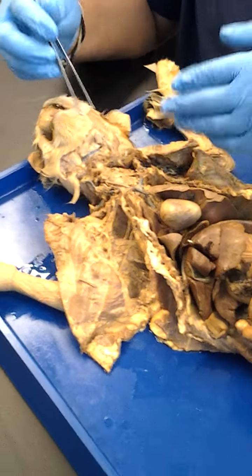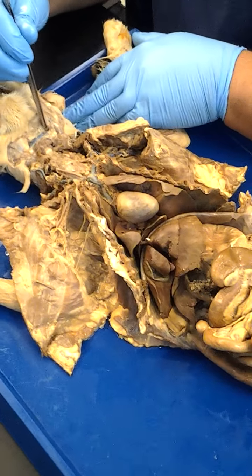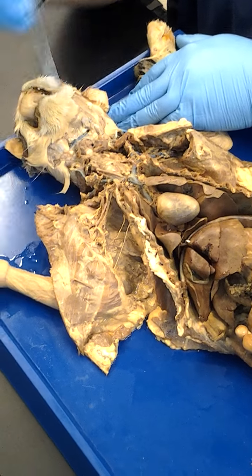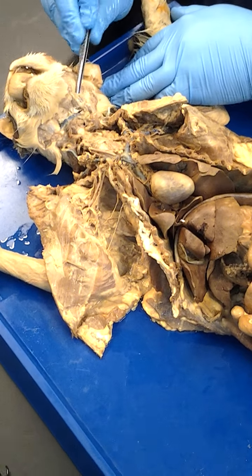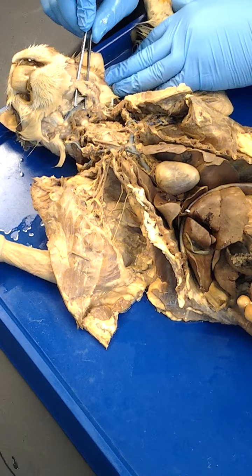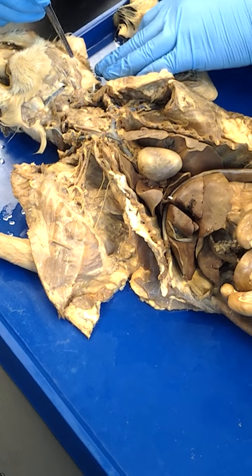And while you were dissecting the muscles of the face and neck of the cat, you were able to then identify the transverse jugular, the external jugular, and then of course this glandular structure right here, which of course is the submandibular gland, which is a salivary gland which helps to secrete saliva into the mouth of the cat. It also secretes saliva in the mouth of you. So that's what that is.